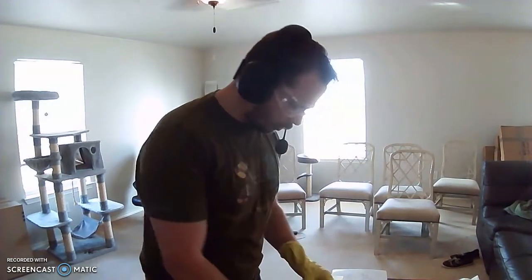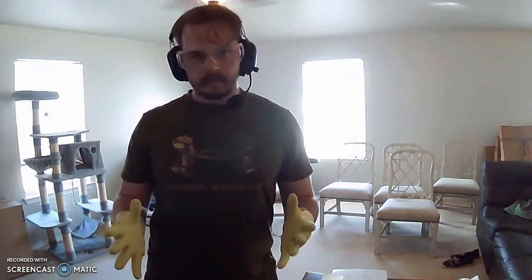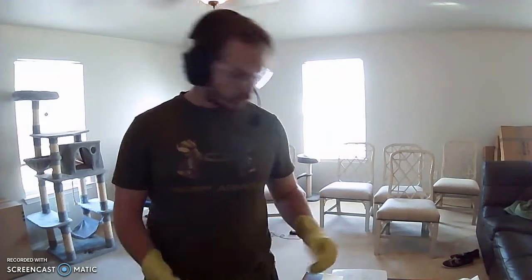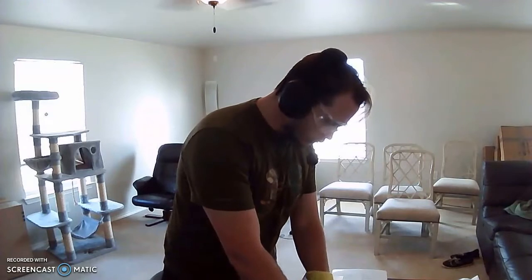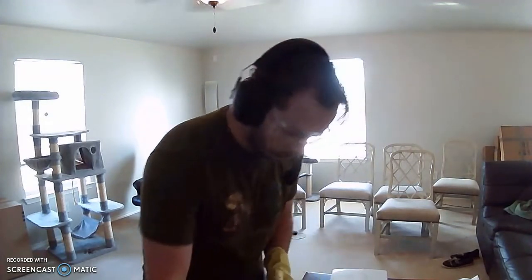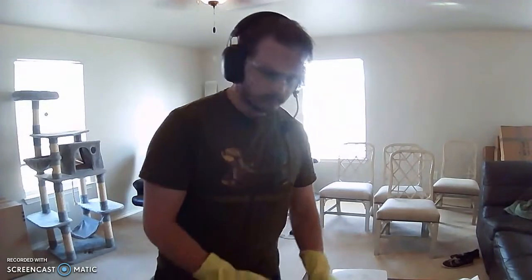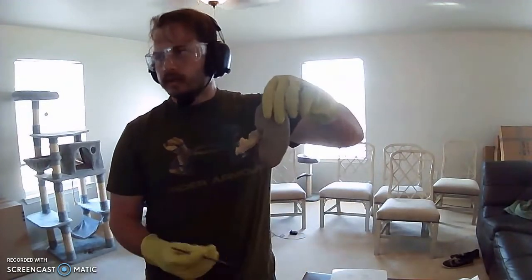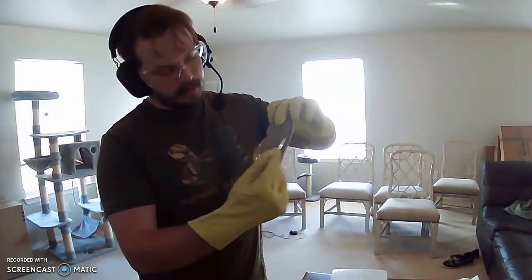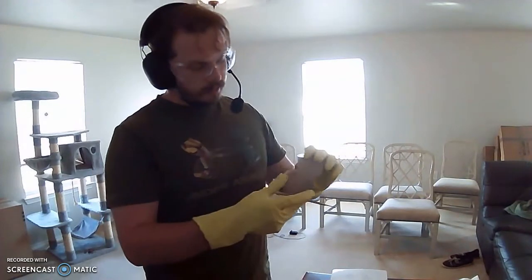Okay, today we're going to talk about the urinary system, more specifically the sheep kidney dissection. So I'm going to go ahead and start us off with a structure we don't really have to know, but the renal capsule on the exterior surface of the kidney.